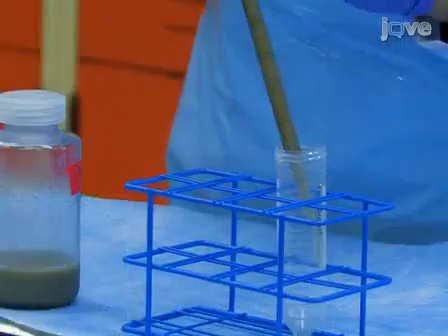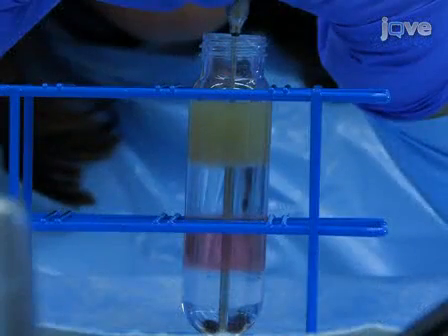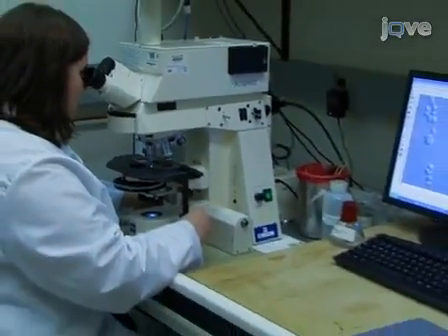Hi, I'm Dr. Sarah Staggs, an employee of Dynamac, a contractor for the National Exposure Research Laboratory of the U.S. Environmental Protection Agency. Today we will show you a procedure for purifying Toxoplasma gondii oocyst from the feces of laboratory-infected cats using a discontinuous cesium chloride gradient. This procedure is routinely used in our laboratory to isolate oocysts for use in molecular biology and tissue culture experiments. So let's get started.